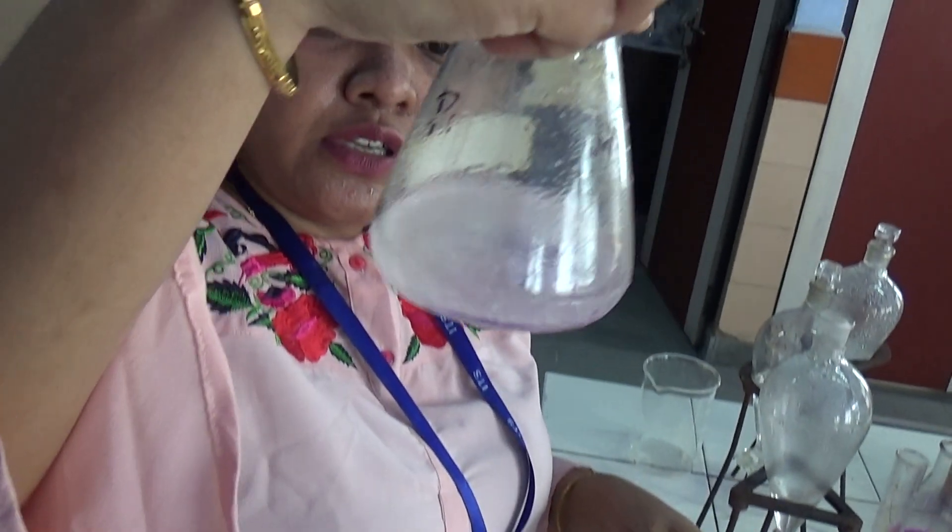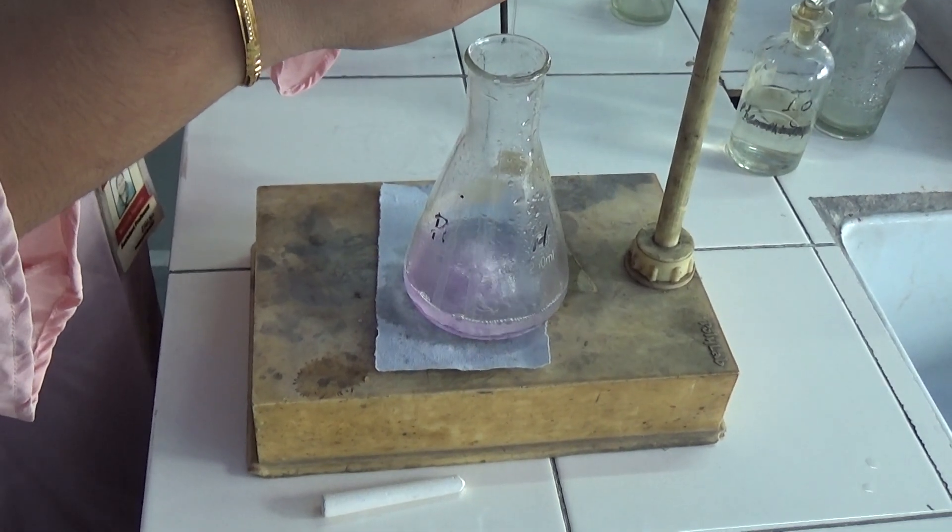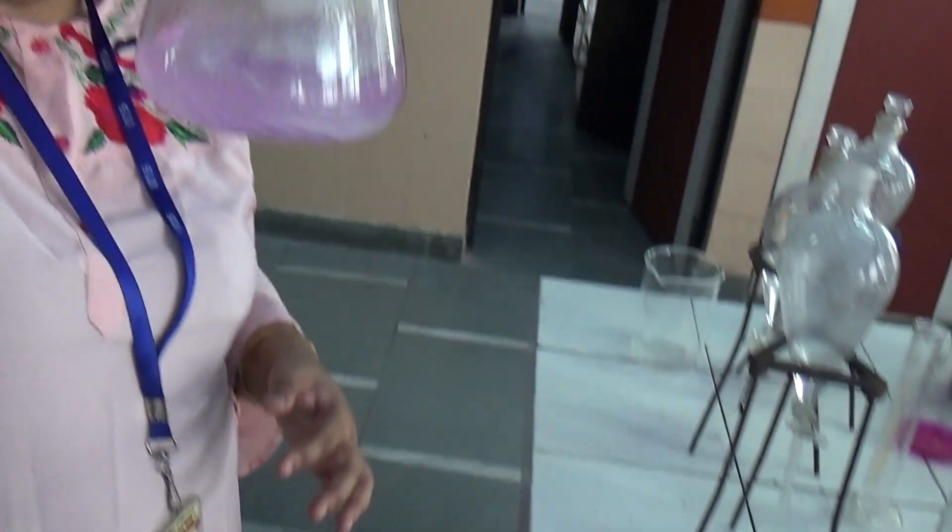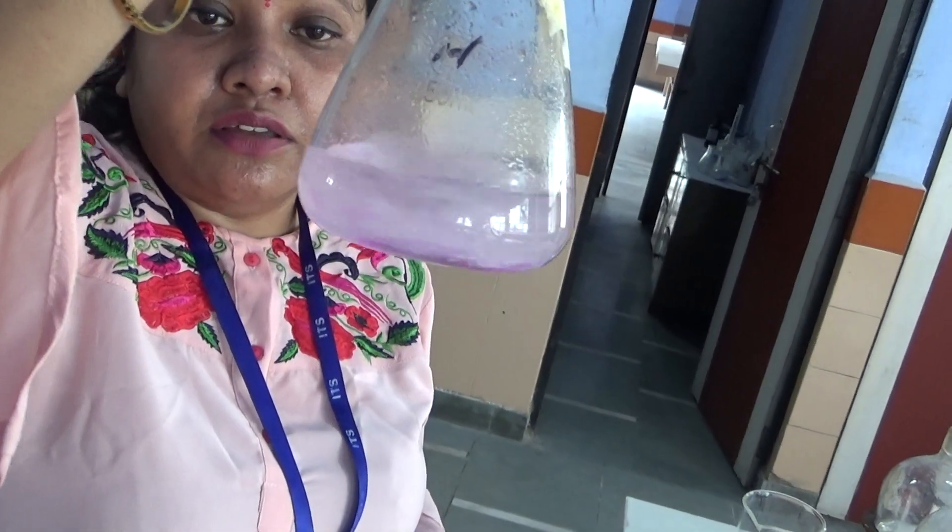This will be your endpoint, pale pink color. This will be your endpoint for the organic layer, that is pale pink color.